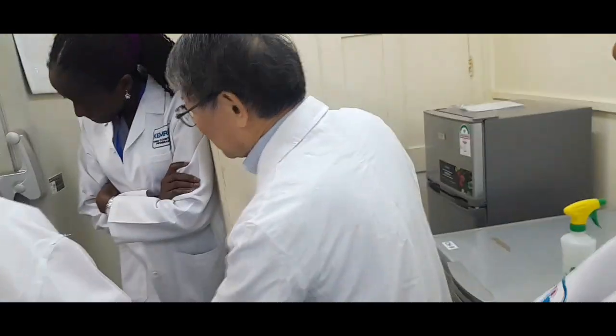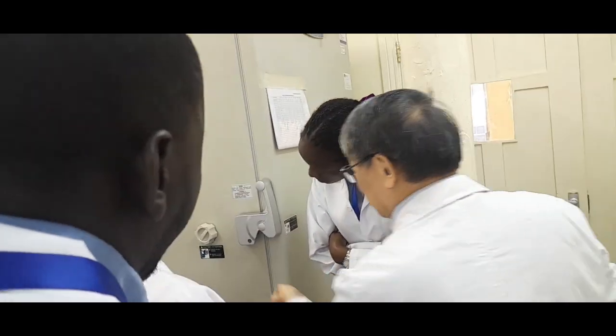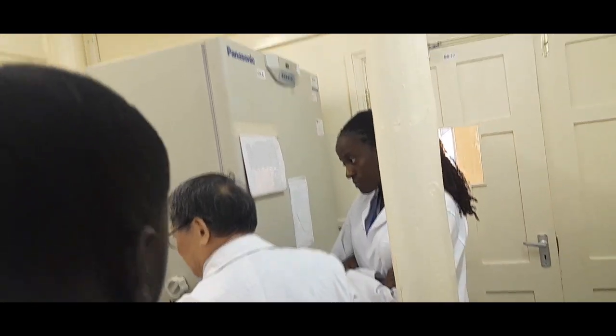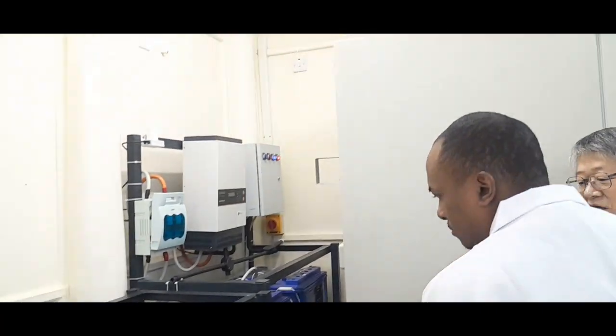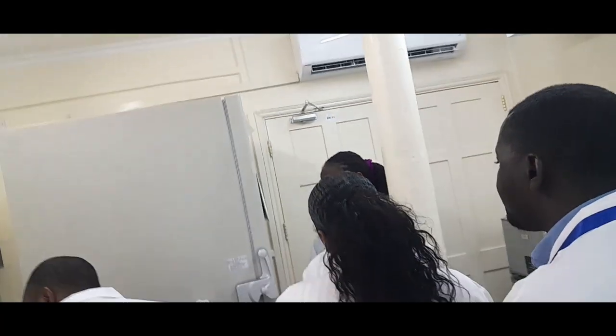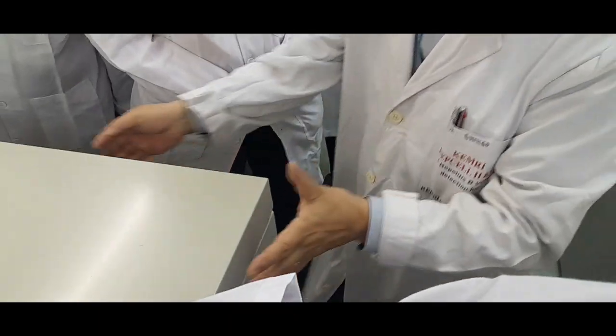We haven't put on the padlock, but we have already prepared it like this, so that anytime we can start the padlock system, so that we can securely store our materials.